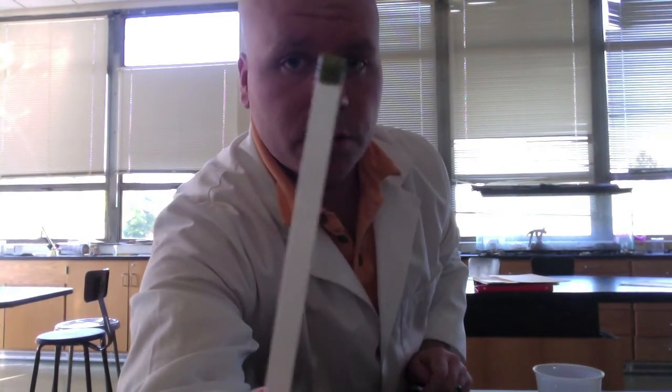Same way, and tie it off. Now you're going to have all those different solutions I mentioned before, either sucrose, glucose, we could try starch, albumin, salt, and see which way the water will diffuse. If that's what you're doing, you're going to take the mass of this before you soak it, and then take the mass after, so you can see which way the water has moved. So let me just show you real quick. We have a positive test for glucose in there. You can see it turn brown.